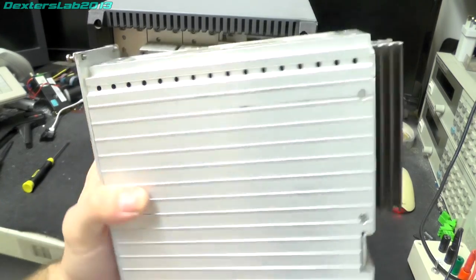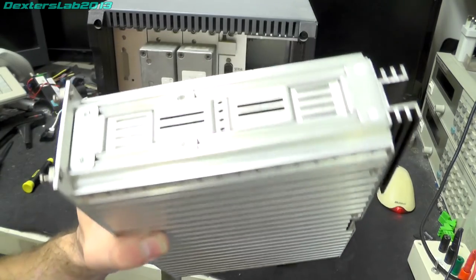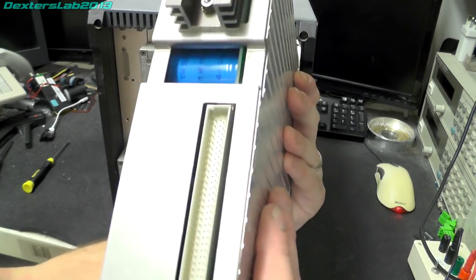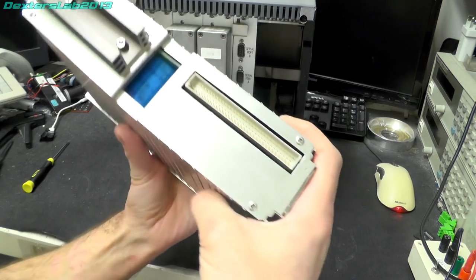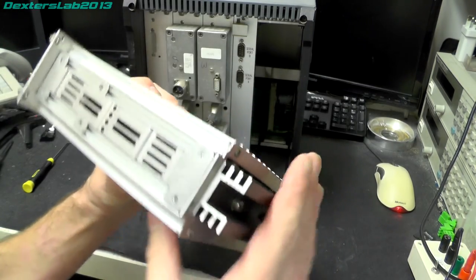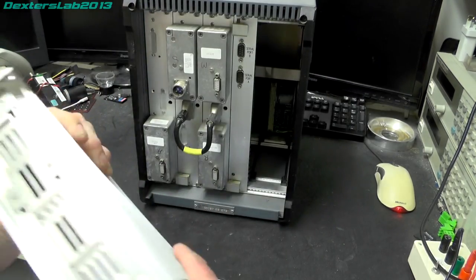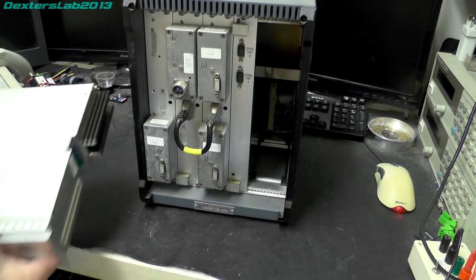Oh, that's quite a nice, let's just turn the brightness down there for you. To, yeah, power supply module. A big connector on the side there. You can see a big capacitor in there. Heatsink. And there's definitely a rattle going on in there. So we'll have a look at that in a moment.